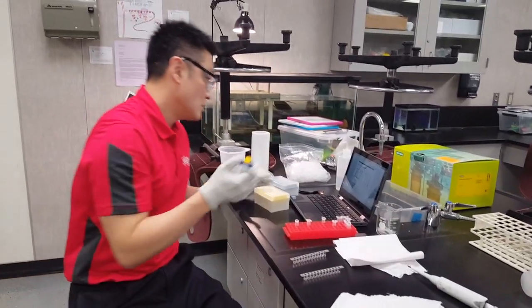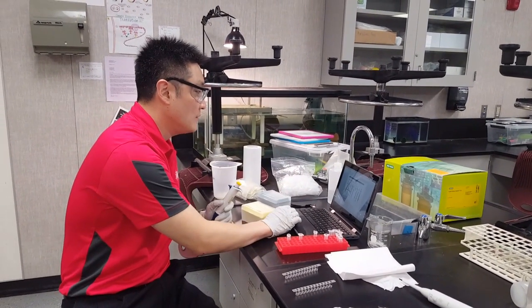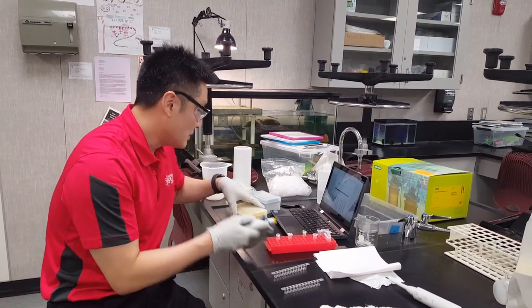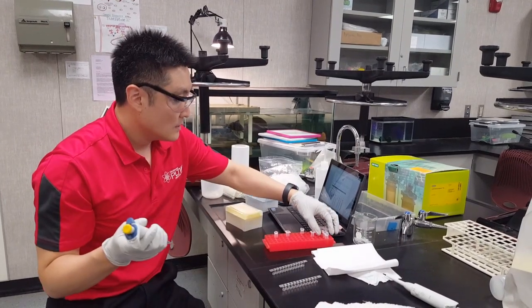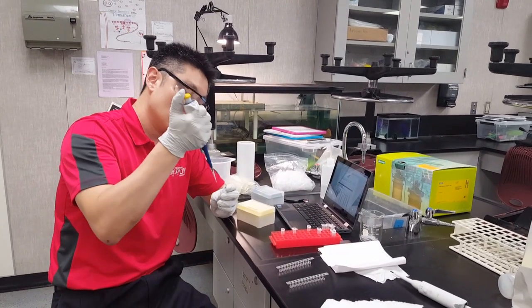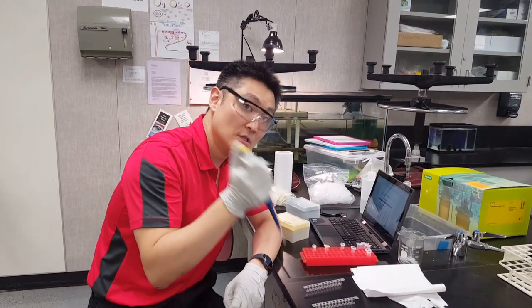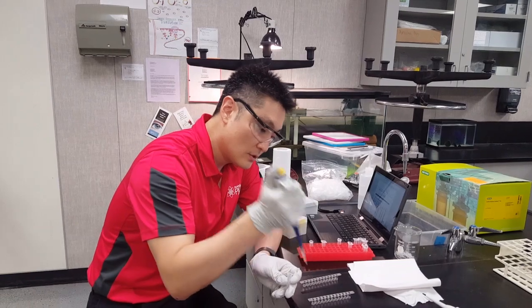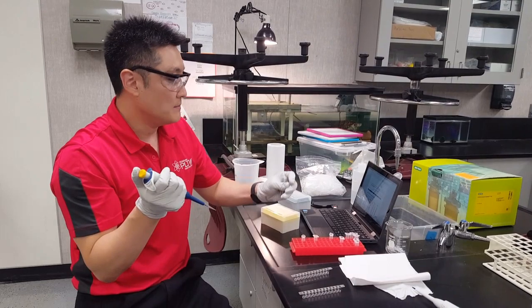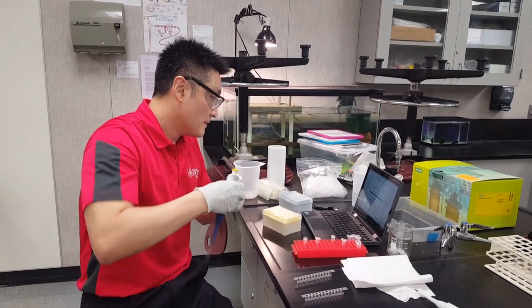Change tips. Now add 50 microliters of the primary antibody to every single well — well 1, well 2, well 3, well 4, and so on through all wells. Once done, incubate for 5 minutes.